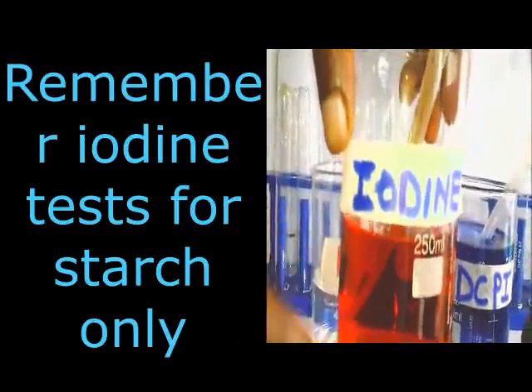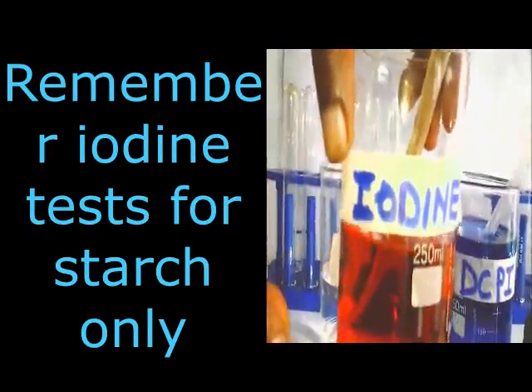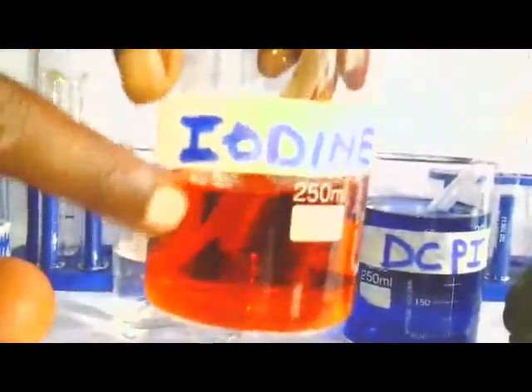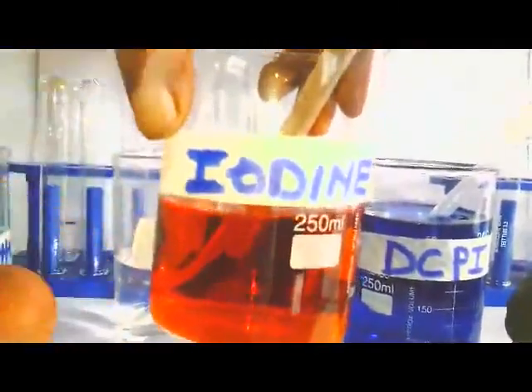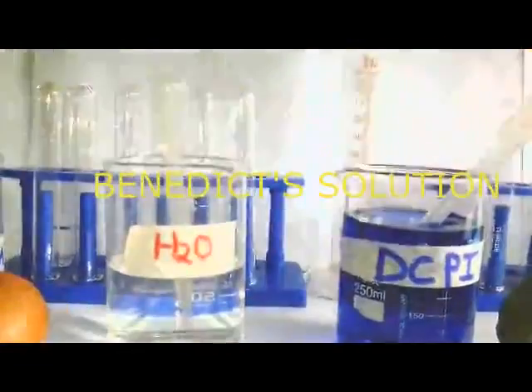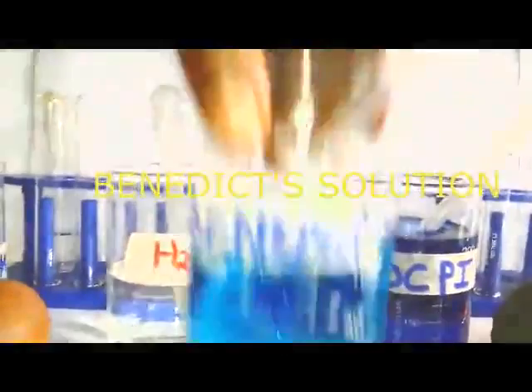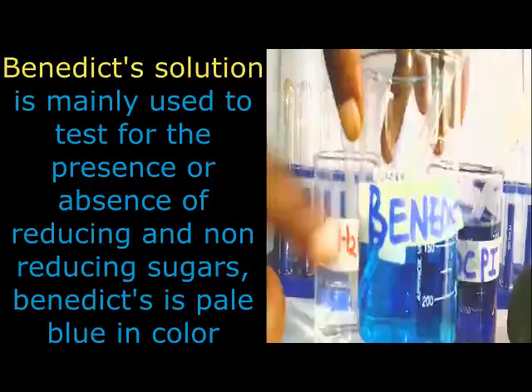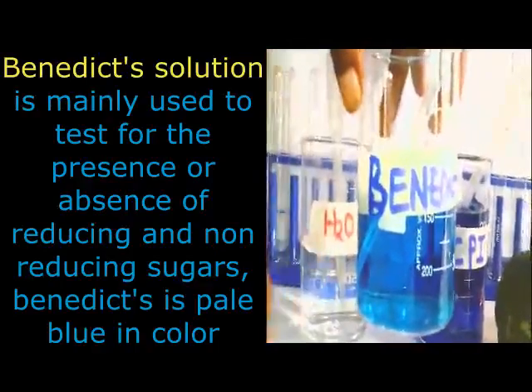Now when you look at ours, it is brown in color. We use this when we are testing the presence or absence of starch. Then another reagent we use when carrying out food tests is Benedict's solution. When you look at it, it is blue in color.